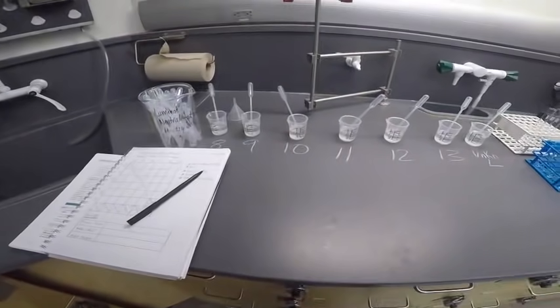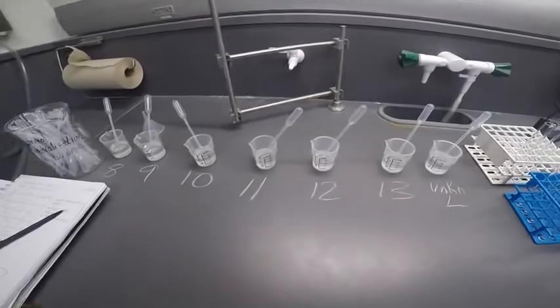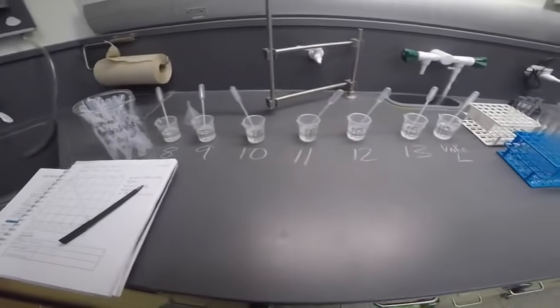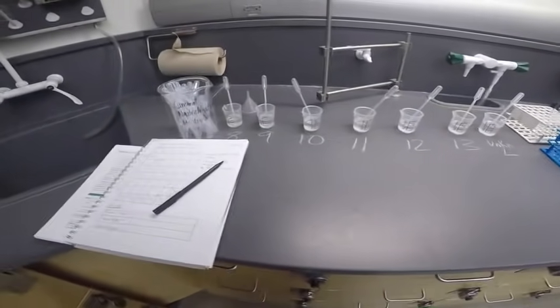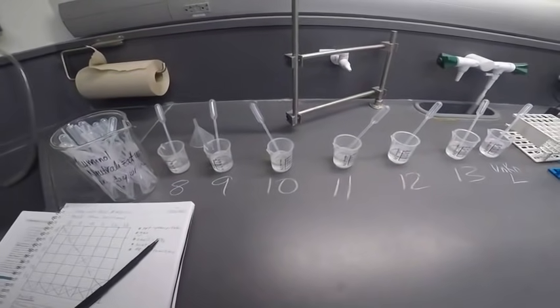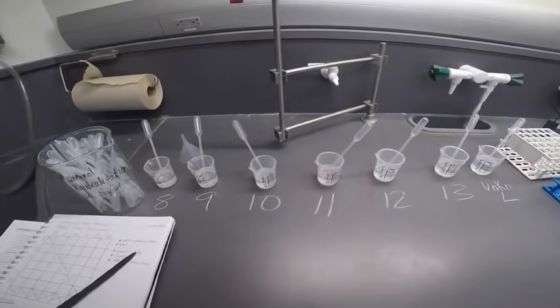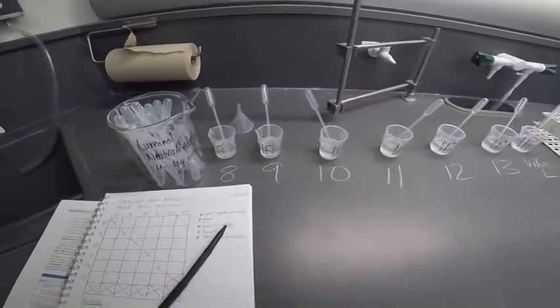The first part is that we're going to use some logic. So if you like to do logic puzzles, you might like this a lot, to identify 6 unknown solutions. So this time around I chose to use the blue set of solutions. And here are the possible identities of those unknown solutions.